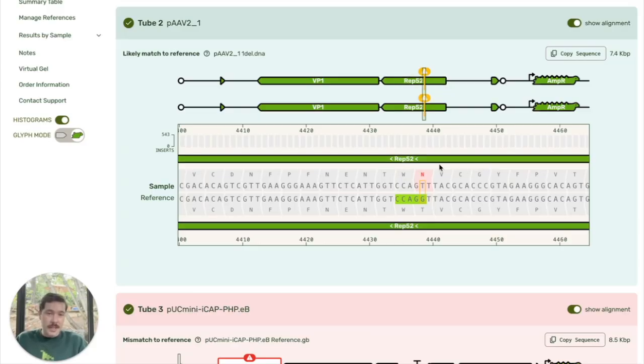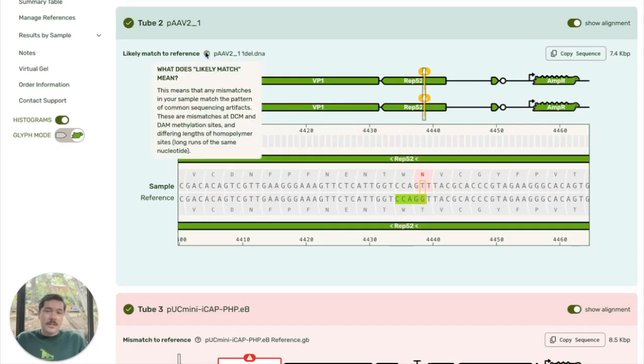this systematic error. So if I look at the per base information, 100% of the time we have a T called. But we know more than the base callers. We know that this type of methylation motif, when it is methylated, can throw off the base caller in that systematic fashion. And so that's why we highlight it as a likely match. And so this means that the mismatches match the pattern of common sequencing artifacts.